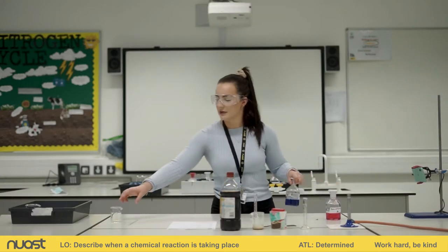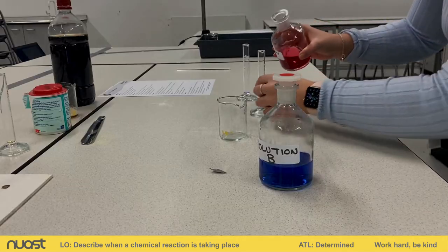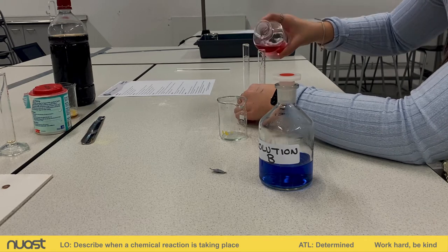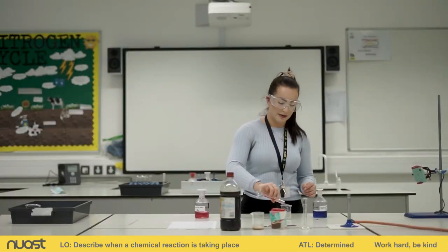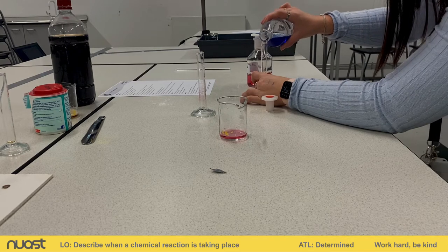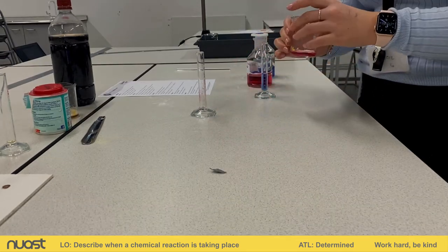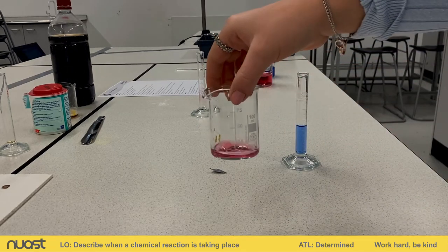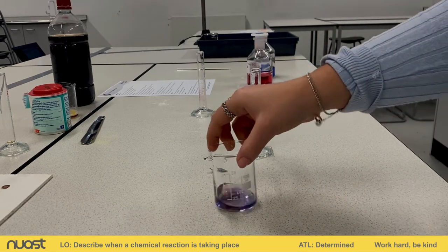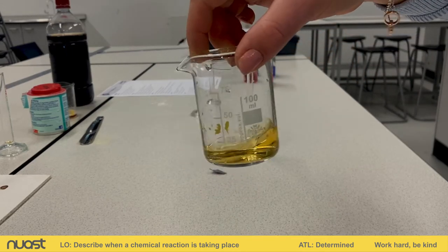I've got my two measuring cylinders and my small beaker. I'm going to add five centimetre cubed of solution A, which is red, carefully into the beaker. Then I'm going to measure the same amount of solution B. So we've got that red solution of solution A — now I'm adding my blue solution and giving it a little stir. What you can see is we've had a colour change — we've got this yellow-orange solution now. So we've seen a colour change for station B.